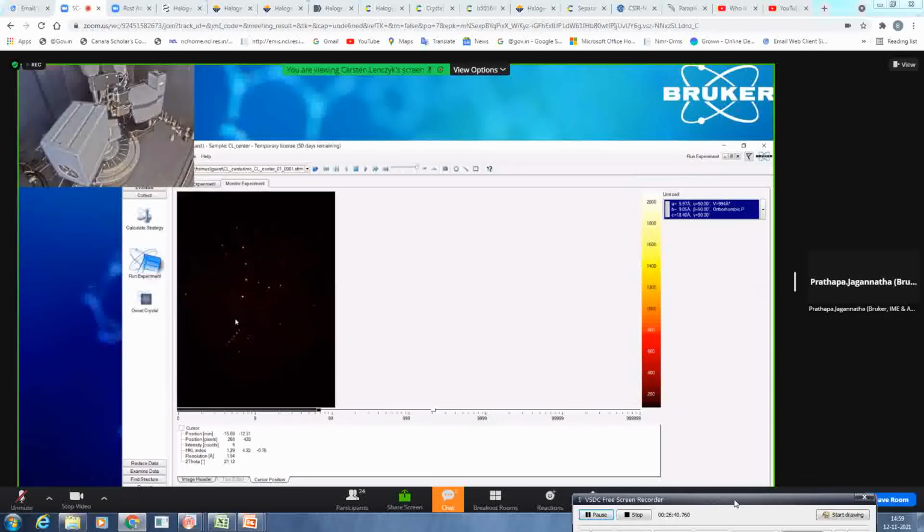Can you explain what source and what detector you're using? Okay, so right now I'm using the IMUS 3.0, so that's a microfocus source. And the shape of this detector might already tell you, so we're using a C14 PHOTON 3 detector. We have 3 different sizes, at least for the PHOTON 3. So it's the C7, it's the C14, and we have also, I guess, the M28.